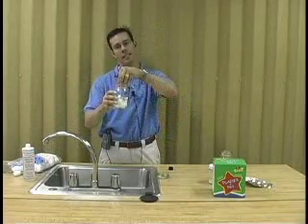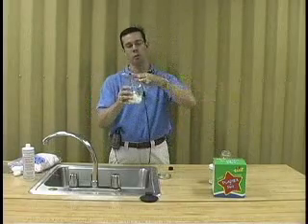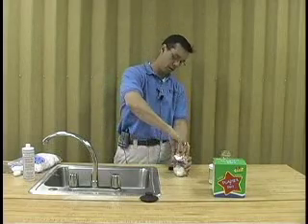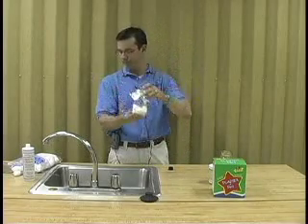And the purpose of the aluminum foil on top is so when you put your insects in, they're easy to get out. Then you can cap it with aluminum foil or a cap that comes with the mason jar. Screw the lid on, and you have a homemade kill jar.